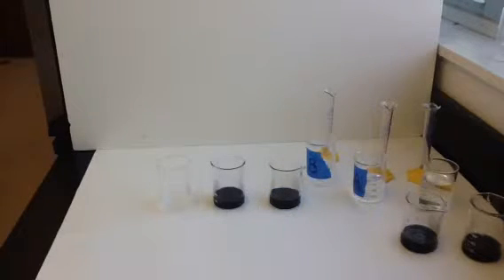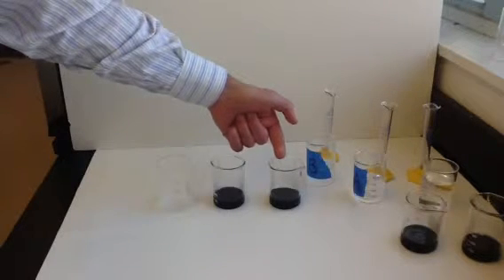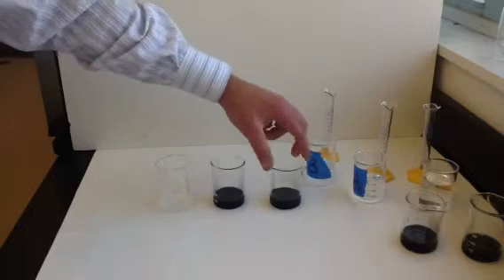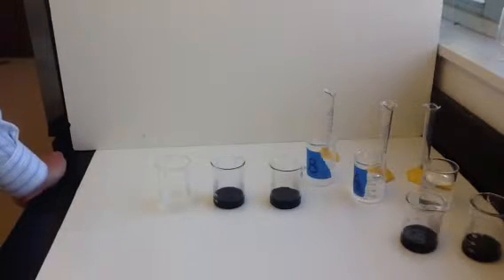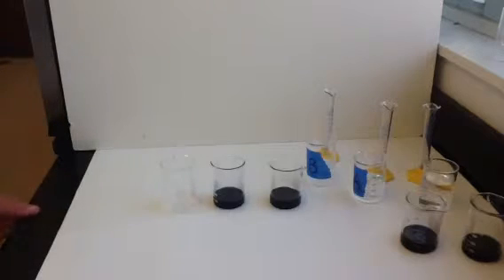Okay, our 3rd trial, the one with 3 milliliters of A and 7 milliliters of water to keep the volume the same, and then 10 milliliters of B, has just changed color. So if you started a stopwatch when that one began, you can figure out how long that one took to occur. Now we're just waiting on our 5th trial, which was the cold solution.